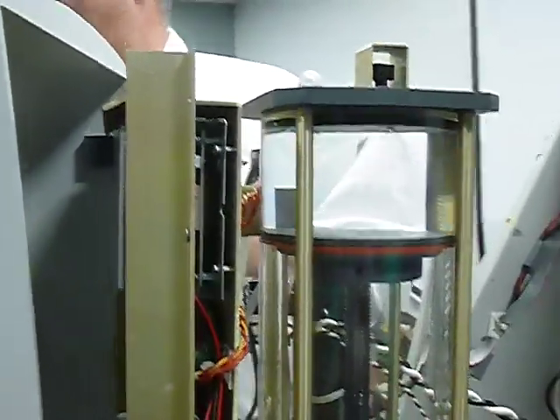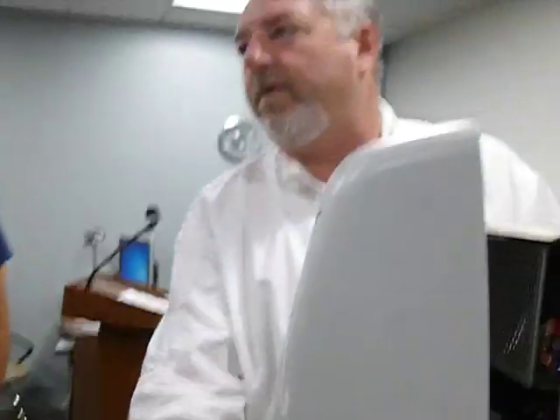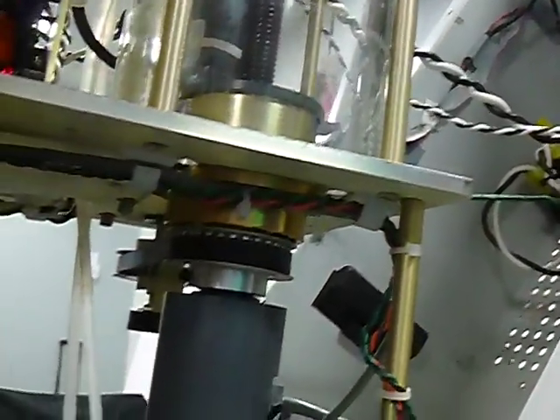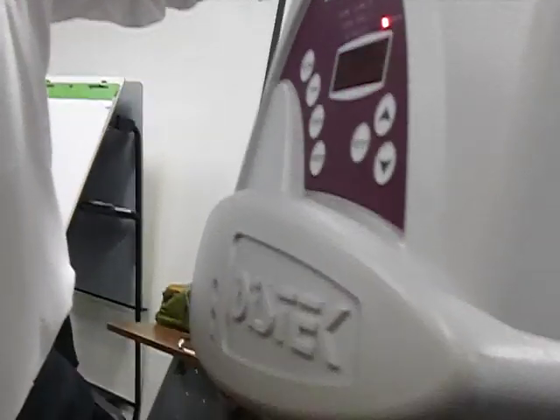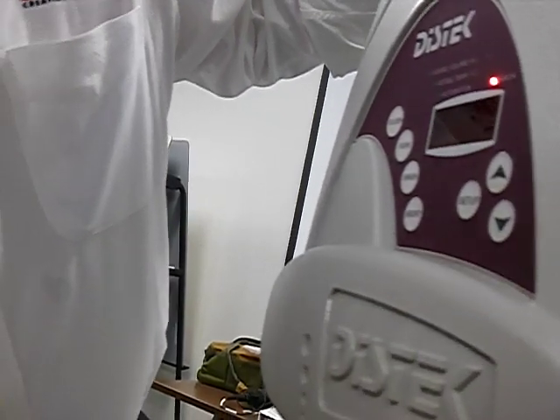Oh, I know why it went out, because we took this off. It thinks it's a remote nozzle. So that's why. So nothing opened up. So we'll put this nozzle back on. Sometimes it's the stupid shit. Did I curse? Under the mini, E11. Yeah, again, some overpressure, I guess. High pressure, but less than the E12.